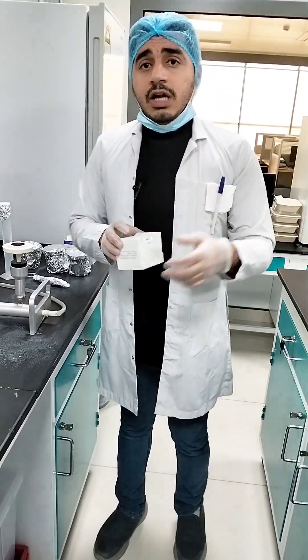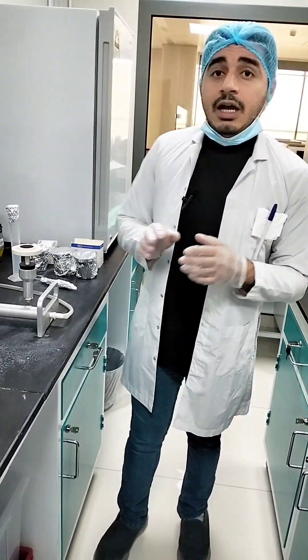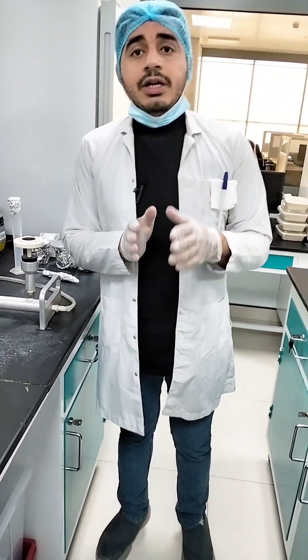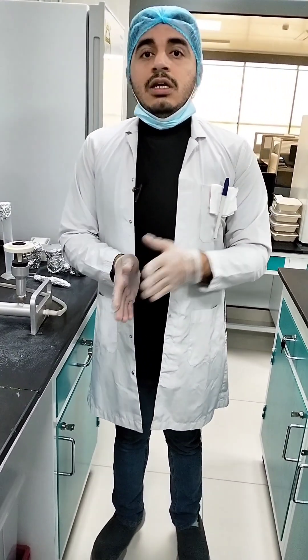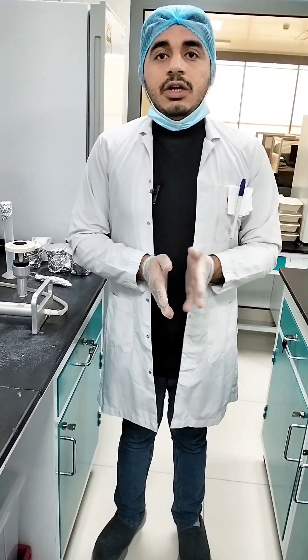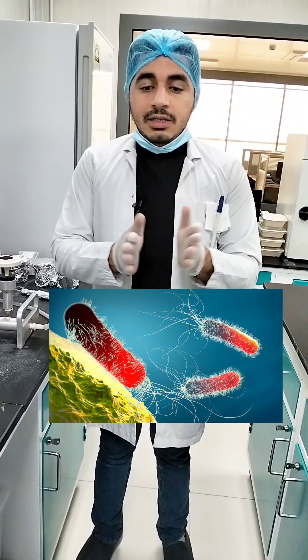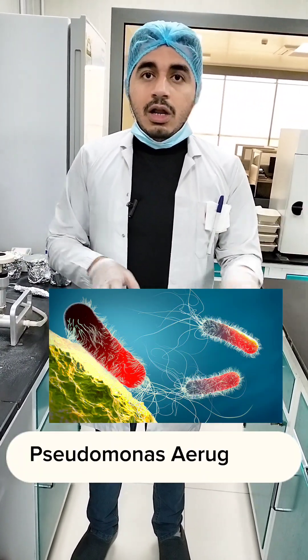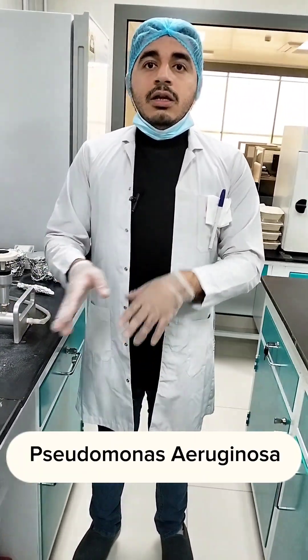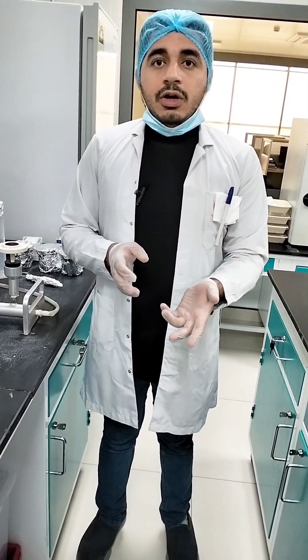Before starting the procedure, I am going to tell you a little bit about Pseudomonas and E. coli and coliform. Pseudomonas is basically a ubiquitous bacteria, meaning it is found everywhere — in soil, the environment, in water, and in fresh water.